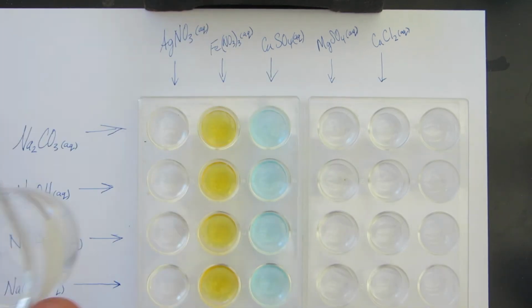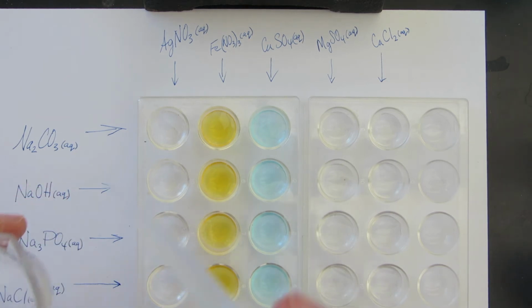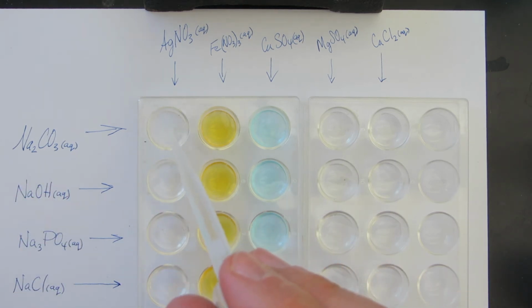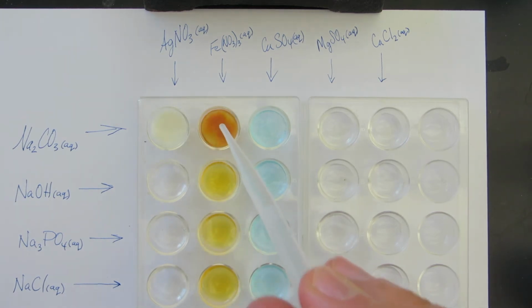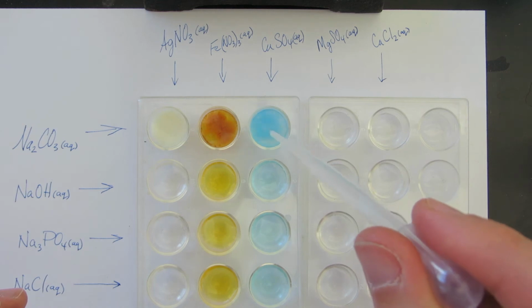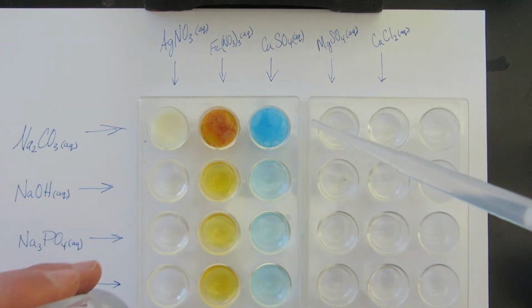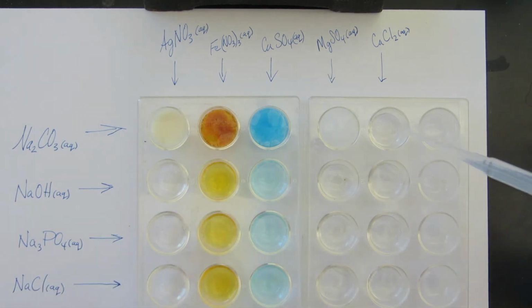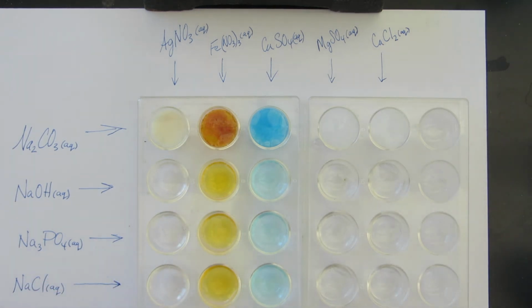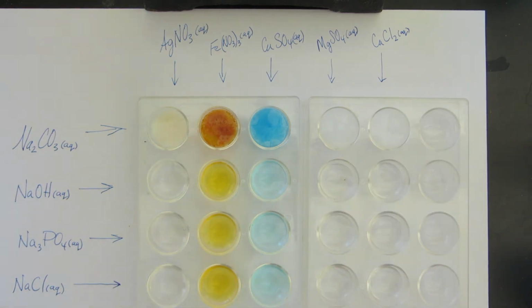Here is sodium carbonate, right? It's aqueous. You can see through it. It just looks like water. All right, here we go. Okay, you can easily see that precipitate. Here's another one. So precipitates, you can't see through them, right? It makes it opaque. All right, so you're seeing these precipitates form. A lot of chemistry is really these white solids. Now, this one's a little bit off-white, but these are just white. All right, there's our sodium carbonate.